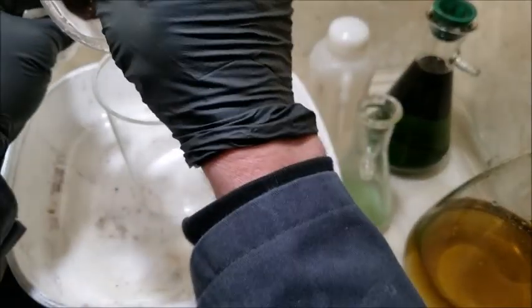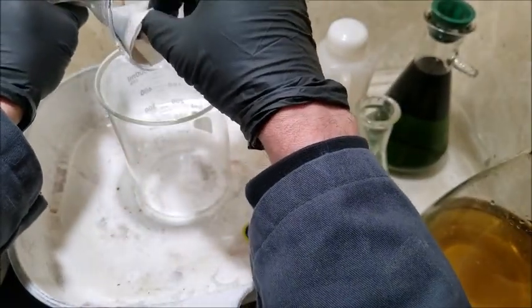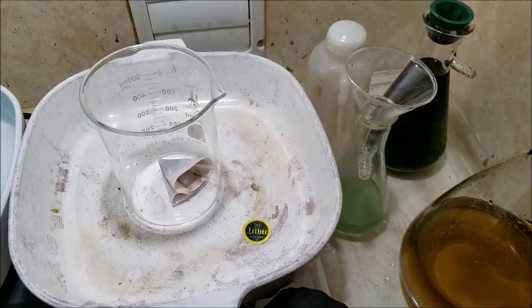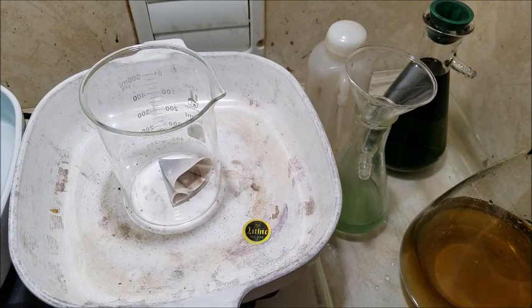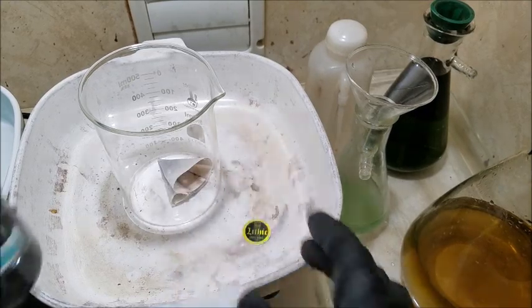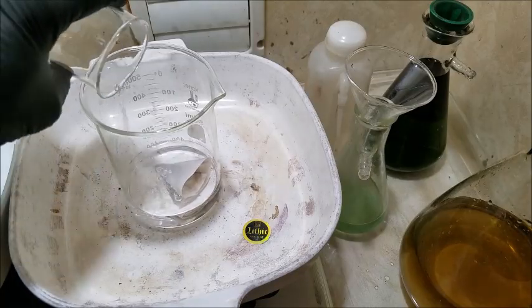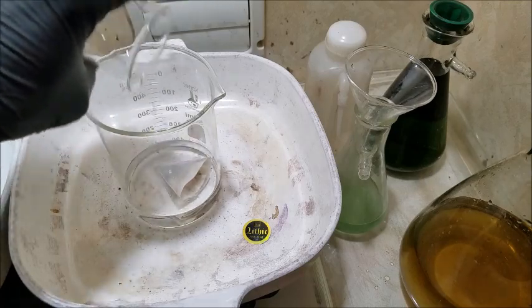We're going to make sure. We're going to refine it again in aqua regia. I'm just going to see about dumping this right in here. Alright. I'll just set this right here out of the way for now. I'm going to turn the heat on, medium low. Get some hydrochloric acid ready here. We don't have to go bonkers. I switched it down to a smaller beaker. We don't have to have a huge volume of solution here. It isn't a lot of gold. There should be plenty.